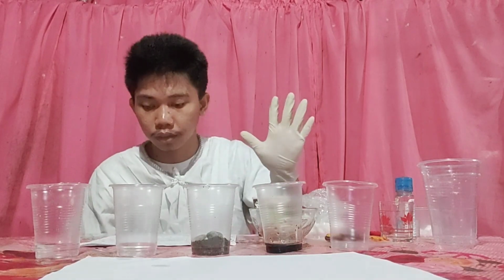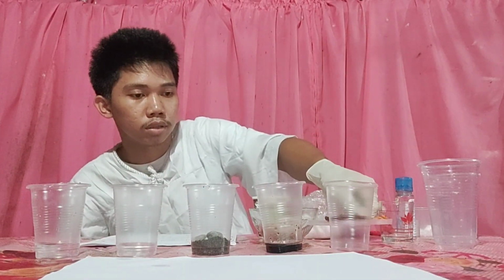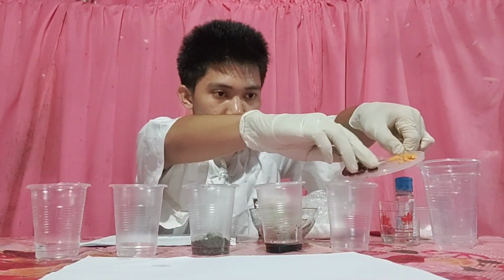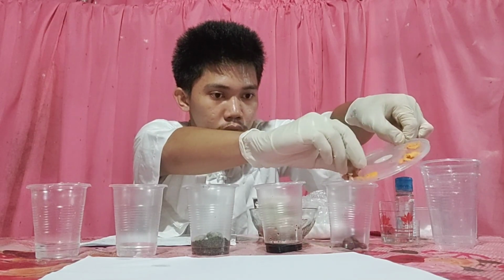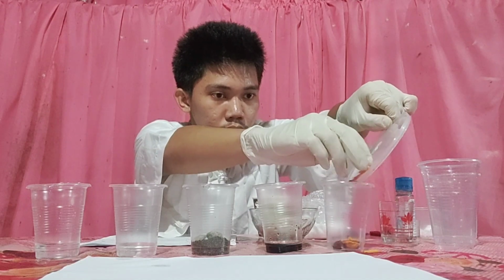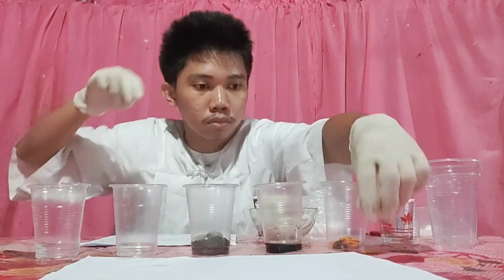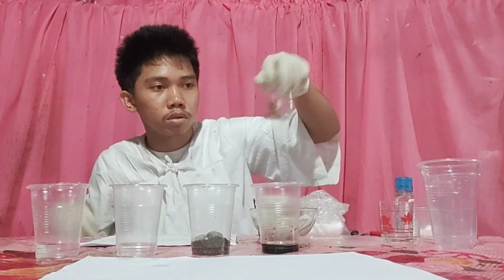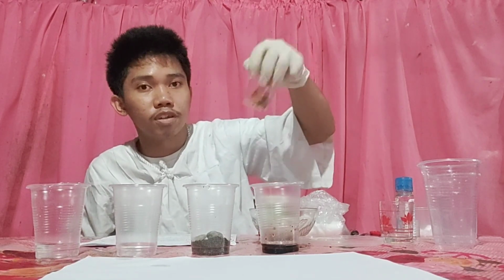And fifth, three varieties of chips. So we will mix the fifth sample.